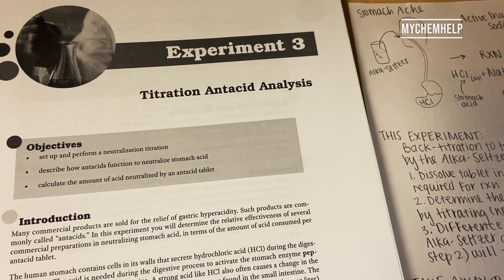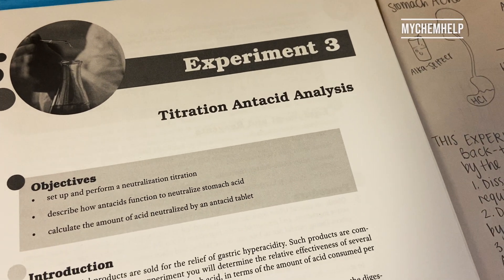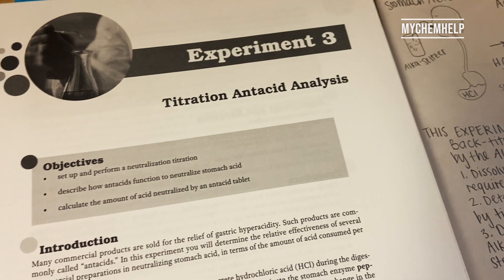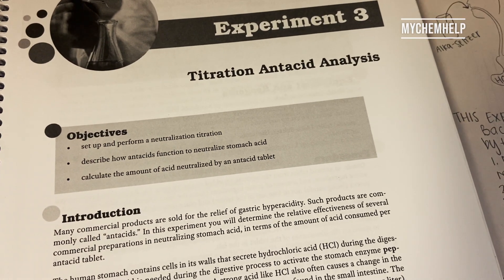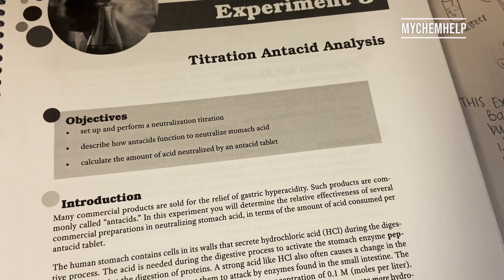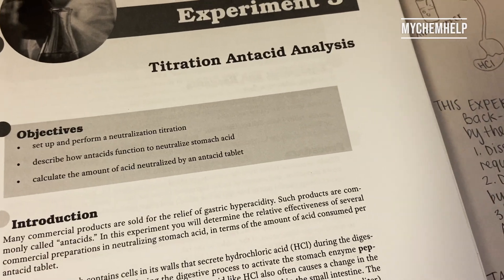In this experiment, we are looking at the effectiveness of an antacid when you have a stomach ache. We are going to be illustrating that through a titration — specifically, we'll be doing a back titration.